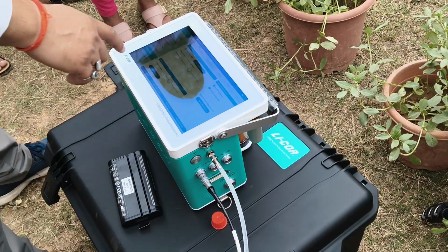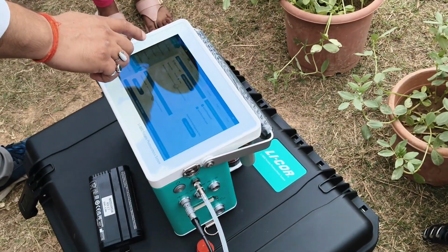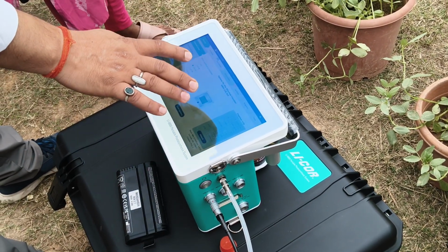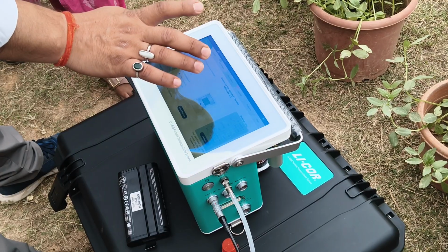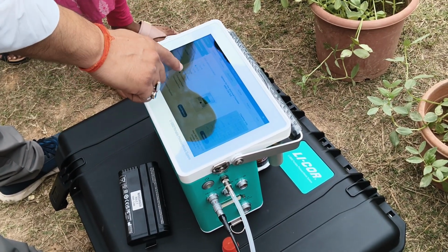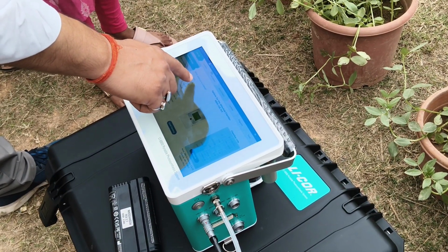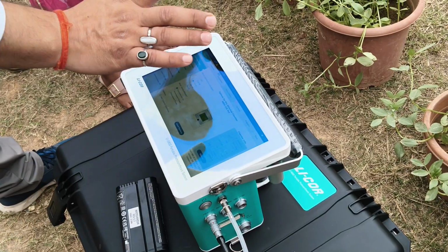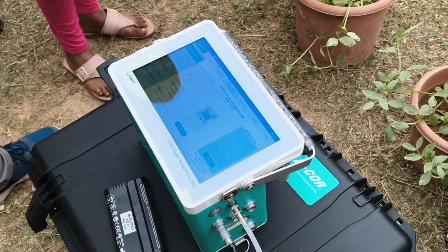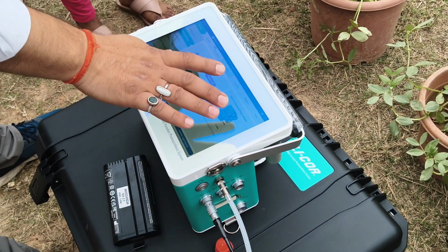There are many functions in this instrument. First we go with the chamber setup. We have provided 3 different apertures: 1 into 3, 2 into 3, and 3 into 3. If you have a leaf less than 1 centimeter wide, you can use 1 into 3. If it is broader, use 2 into 3, and if it is more than that, 3 into 3 is better. Your leaf size should be more than the aperture size. You cannot do anything in the peripheral step.